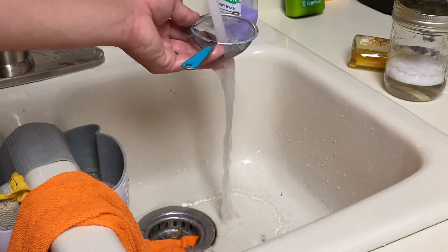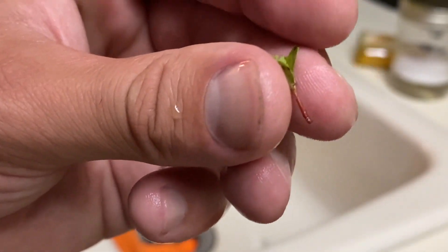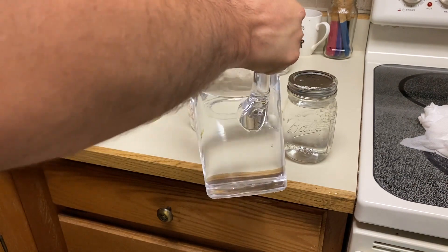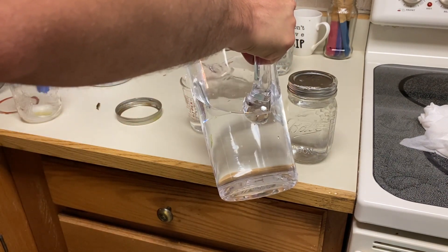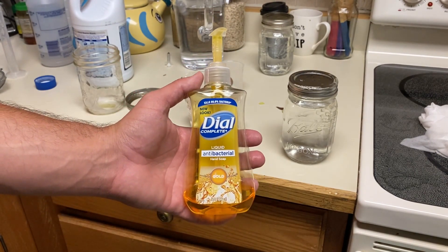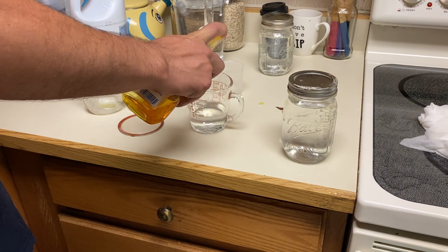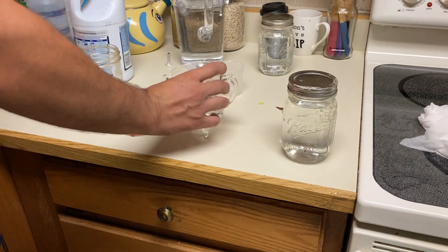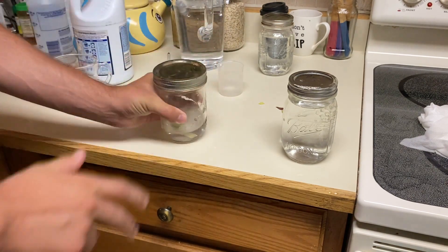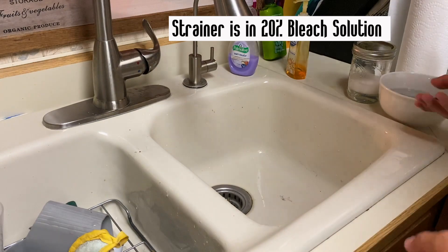I'm going to sterilize all these plants. I run them under the faucet for a minute or two just to rinse them, then cut off the bottom part of the stem. We're making a 1% bleach solution: just 1 milliliter of bleach and 99 milliliters of water — I'm using the reverse osmosis water for this, you can use distilled. Also add two drops of liquid antibacterial hand soap — you can use dishwashing soap; you want something without any scents. The actual laboratory reagent used for this is called Tween, but soap works just fine.